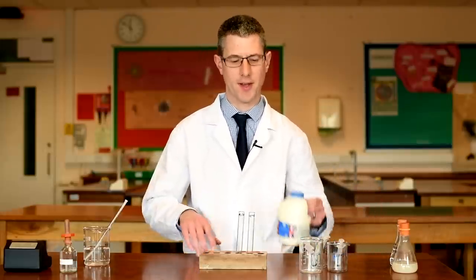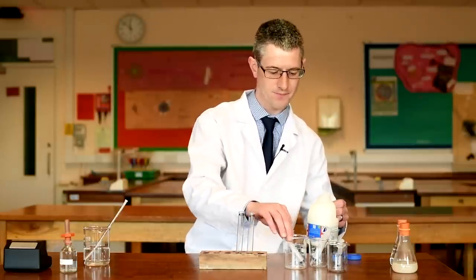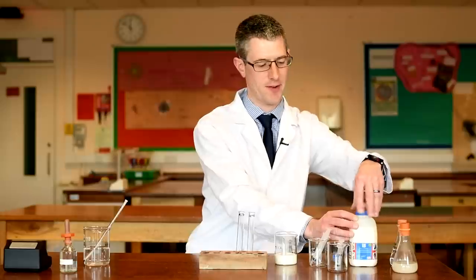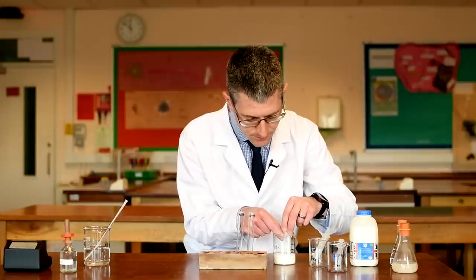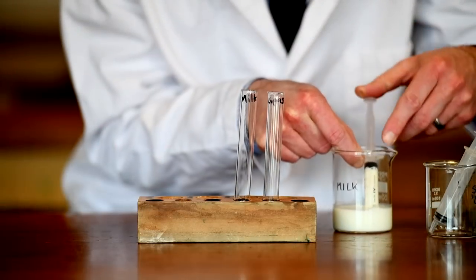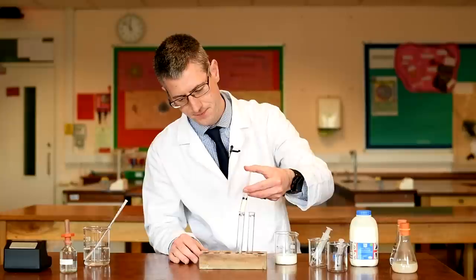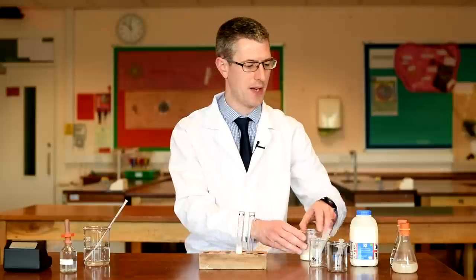First off we've got a sample of fresh milk — full fat milk is required here, you can also use cream. I'm going to use a syringe to measure out 5 ml or 5 cm³ of milk accurately. Let's check that's measured accurately — that goes into one of our test tubes. So we've got 5 millilitres of milk.